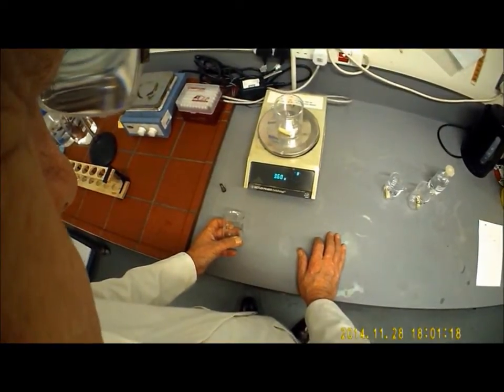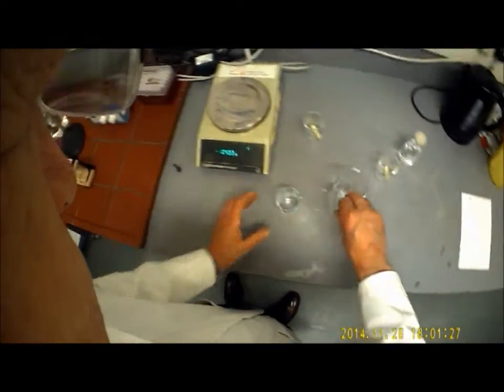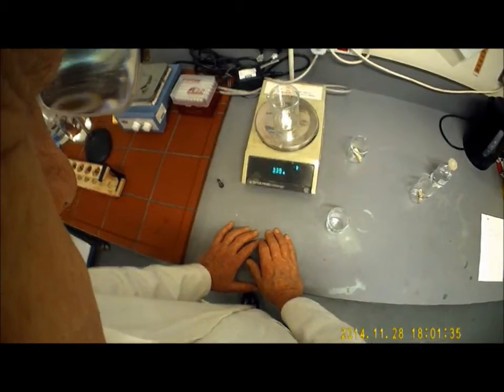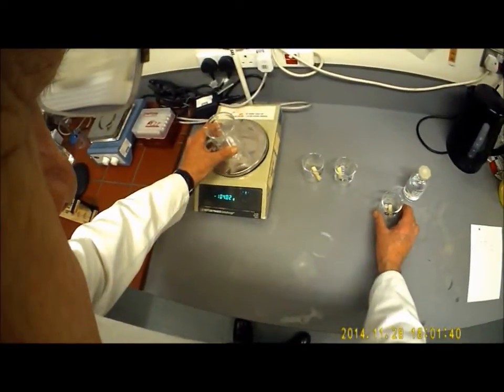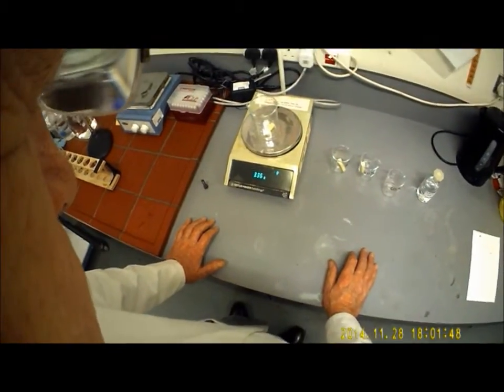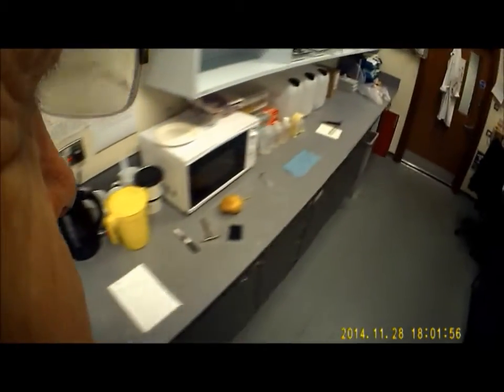So the mass at time 0, 3.6 grams. Back it goes. 40% core. Zero the scales again. 3.39. Into the 0 minutes column. Okay. Find our 60%. 3.36. Back into the pot it goes. Okay. We're going to leave that beaker there because we're going to need it every time we reweigh.